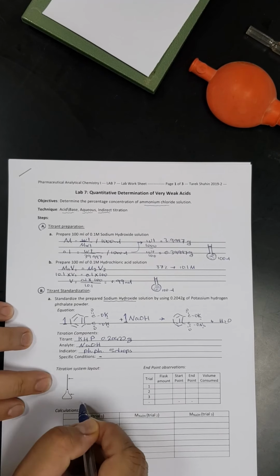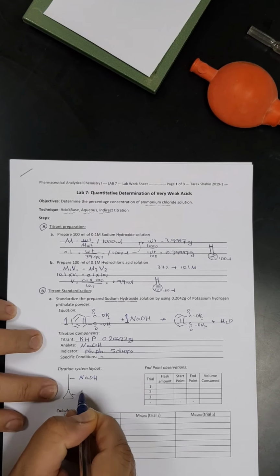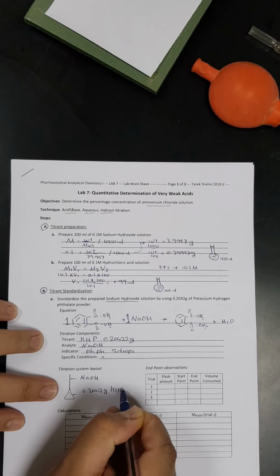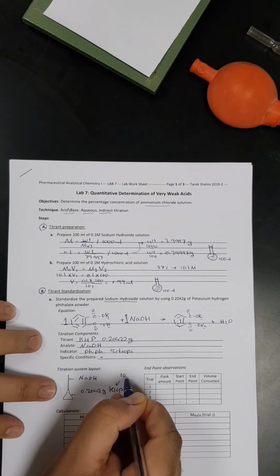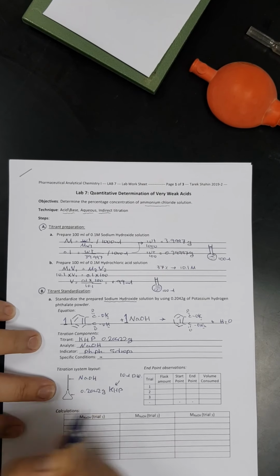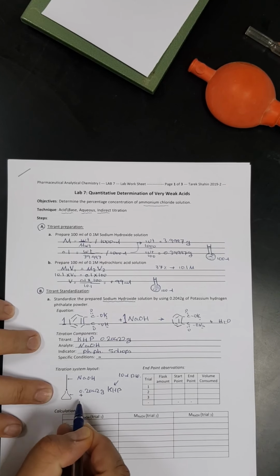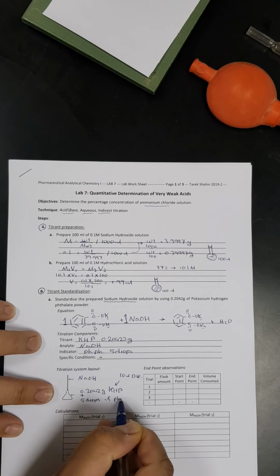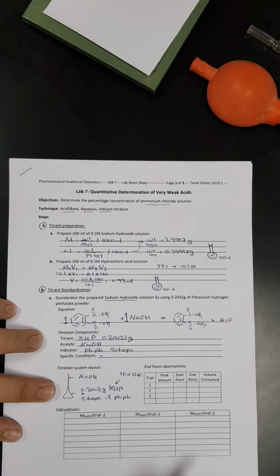So next, I will do the titration layout. In the burette, I will put sodium hydroxide. And here in the conical flask, I will put 0.2042 grams of potassium hydrogen phthalate. But this amount is in powder form, so I have to make it soluble. So I will add up to 10 ml of distilled water, just to dissolve the potassium hydrogen phthalate, so it will be a liquid-liquid titration. In addition to that, I put an indicator, which is 5 drops of phenolphthalein. And then I will write the findings according to the experiment and the titration outcomes, and then I'm going to get the molarity of the sodium hydroxide.